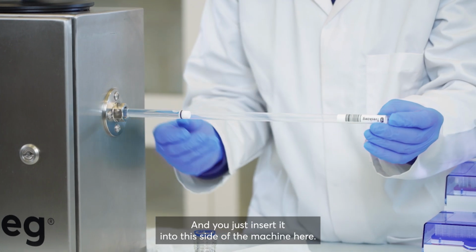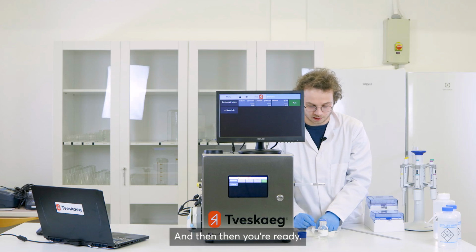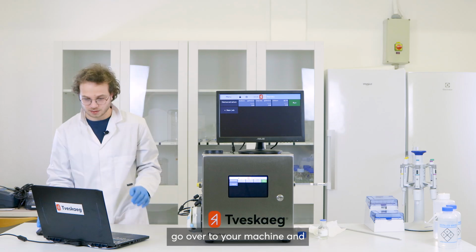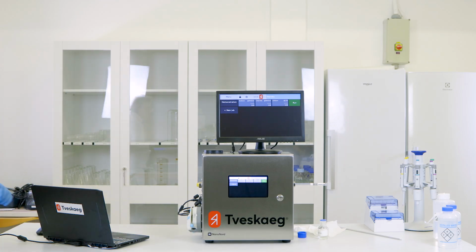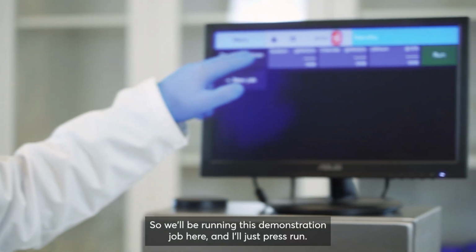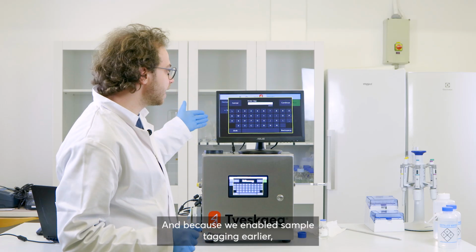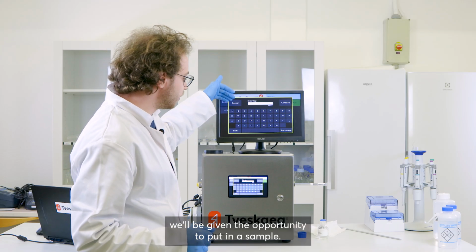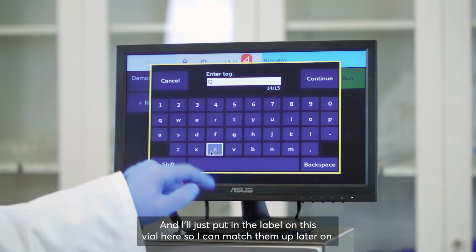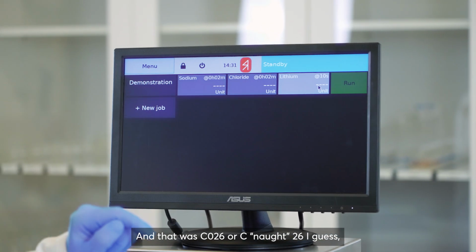You just insert it into the side of the machine here, and you push until it hits the end stop, and then you're ready. So what you'll do next is go over to your machine, and then you simply press run on the job that you want to run. So we'll be running this demonstration job here, and I'll just press run. Because we enabled sample tagging earlier, we'll be given the opportunity to put in a sample tag, and I'll just put in the label on this vial here so I can match them up later on. That was CO26, or C026, I guess.